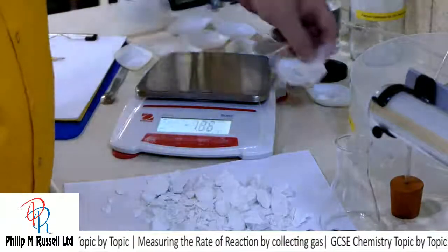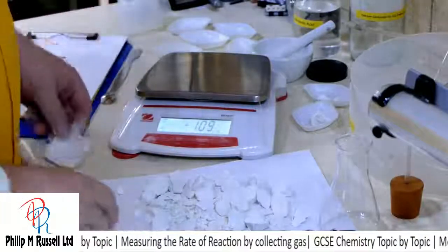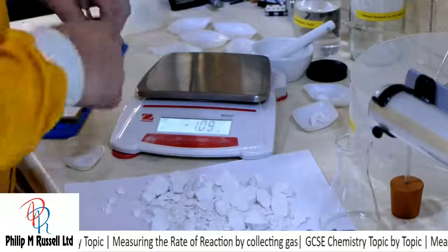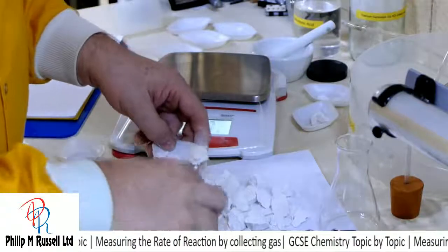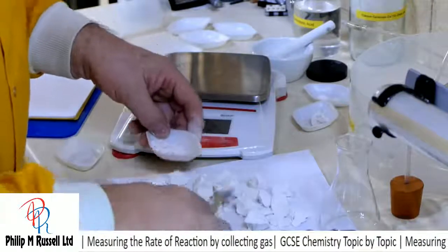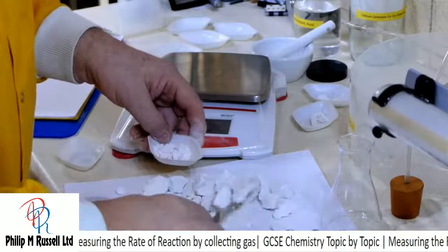And then what we're also going to need is some really small stuff, and to do that I'm just going to scoop up some of this small stuff, this powder and small bits.